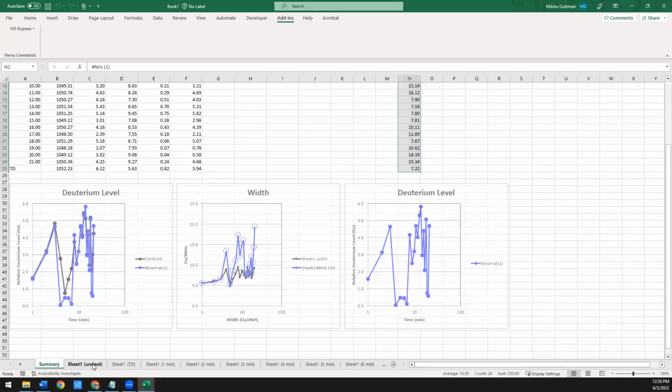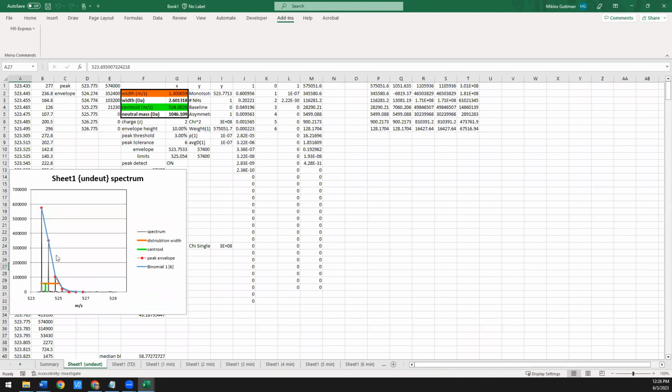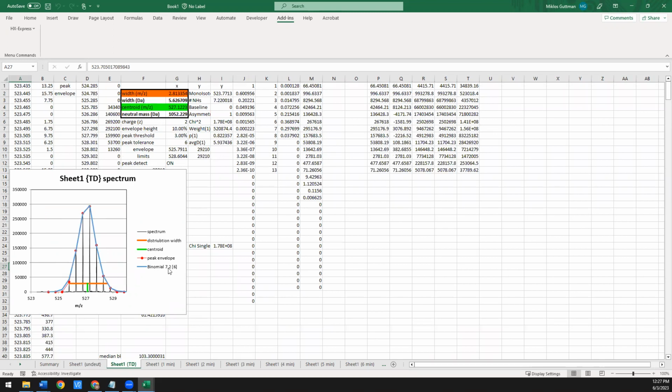So if we look through all the actual worksheets now, you see that each of them will now have this blue line, which indicates the binomial fit. And it's a really good sign when your undeuterated matches really well to the theoretical. It means you have a clean spectra and you have your peptide assigned correctly. You'll also notice that now the fit has this binomial 1, and then in brackets, there's a number. This is how many amides it used for the fit. So for example, here, it's actually not the brackets, ignore that. It's actually the number before the brackets.